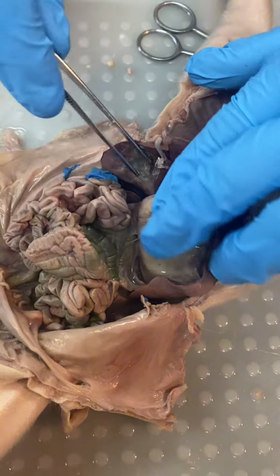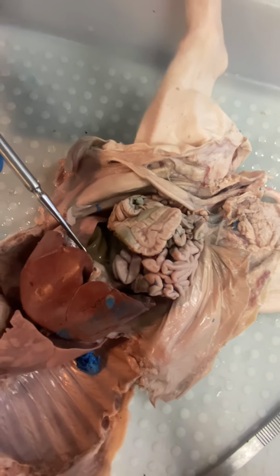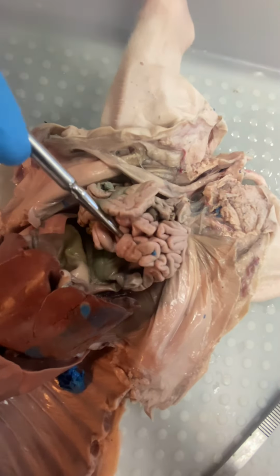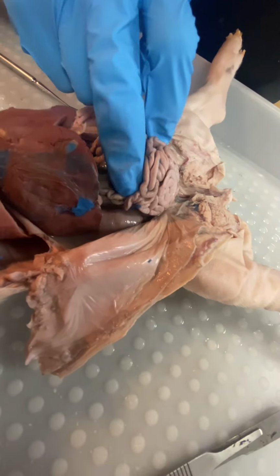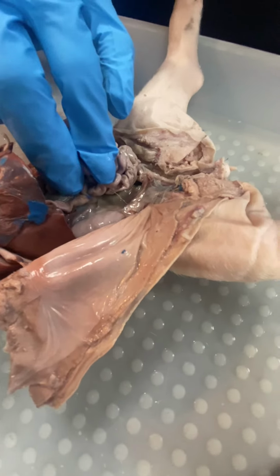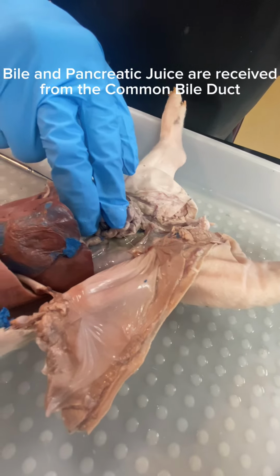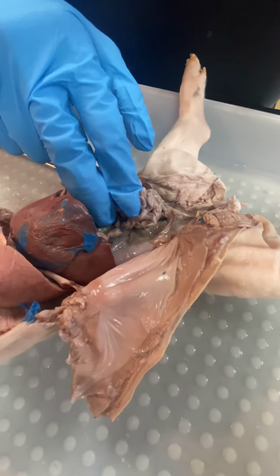This is the pancreas. There's a bunch of acid in the stomach, which turns the food into chyme. The chyme passes into the duodenum, which is connected to the stomach. There it is. It's the part of the small intestine that's connected to the stomach. There it's met with bile from the gallbladder and pancreatic juice, which neutralizes the acid.